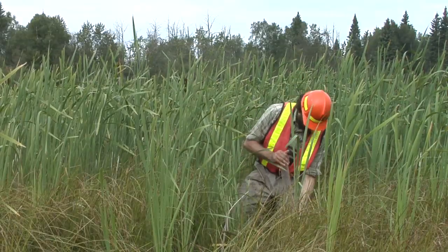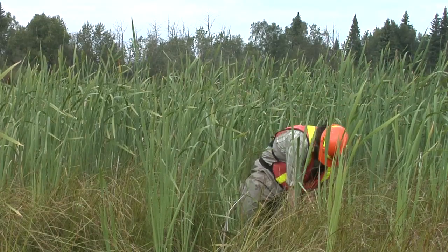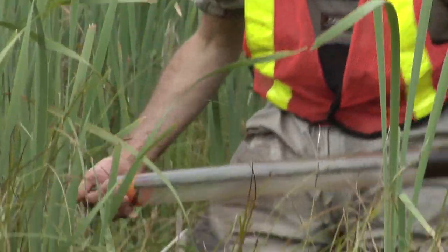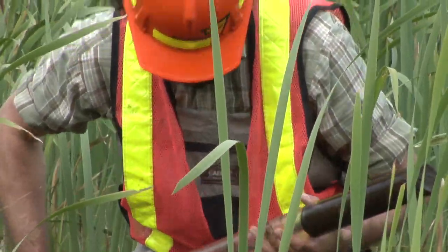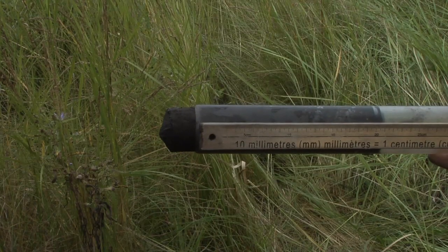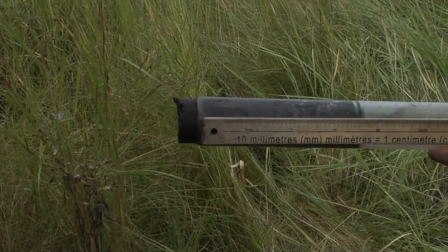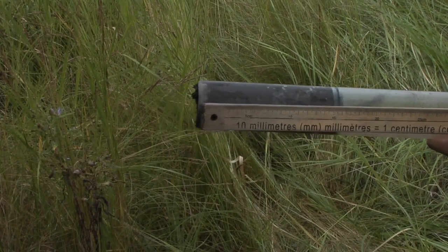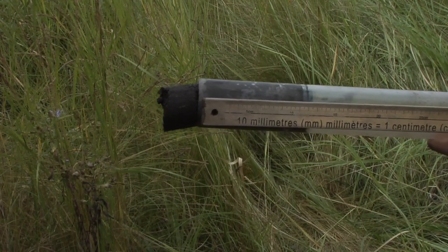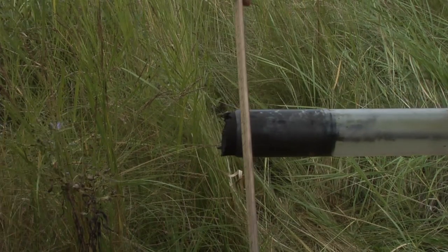Sediment cores are taken with a suction corer. The corer is pushed about 20 cm into the sediment while the plunger is held still at the surface. Pull the corer out of the sediment while holding the plunger in place to remove the sediment core. Extrude excess sediment until you have a 10 cm core. Any type of corer that can collect a sediment sample of the same volume can be used, but we recommend a suction corer where the plunger seals the tube creating a suction to retain the sediment in the corer.